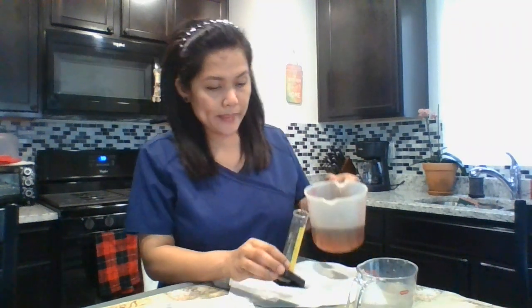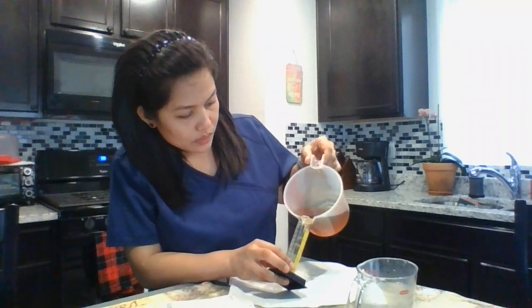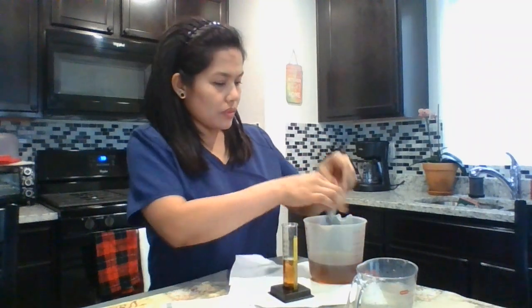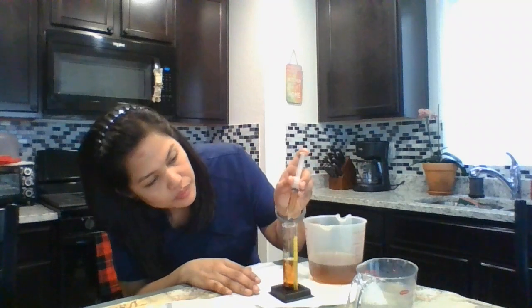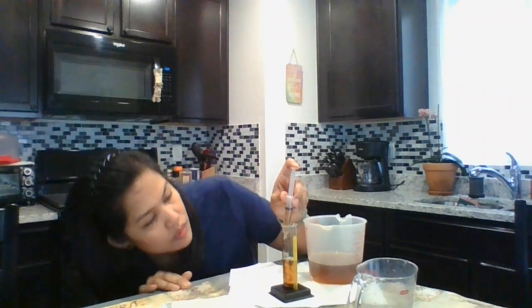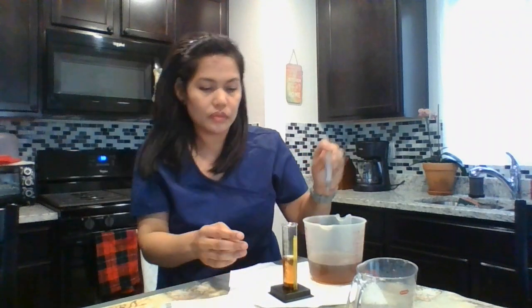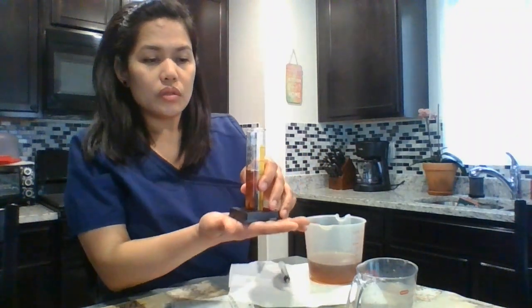So I have 33 milliliters — I will times it by 5, so 33 milliliters times 5 equals 165. I'm going to measure 33 ml. So this is 33.